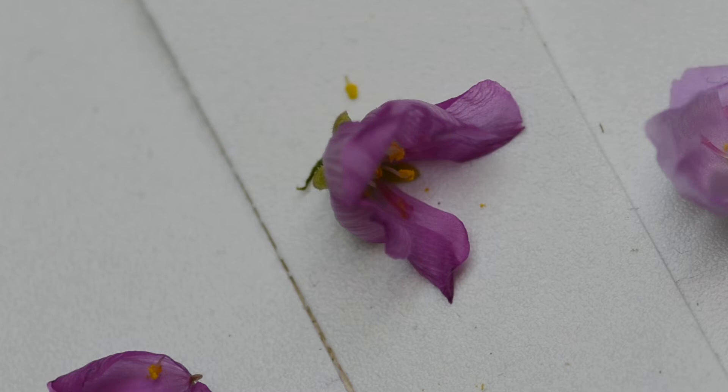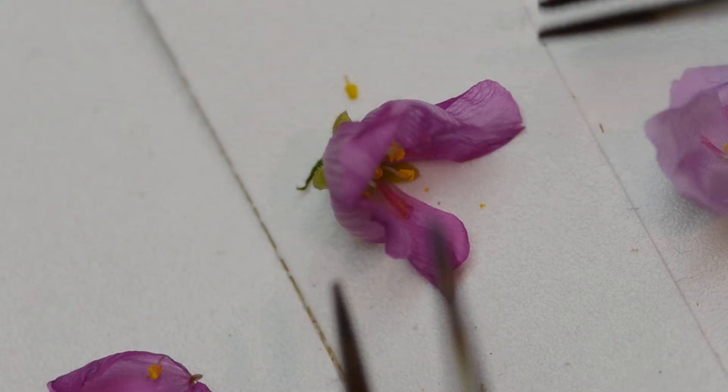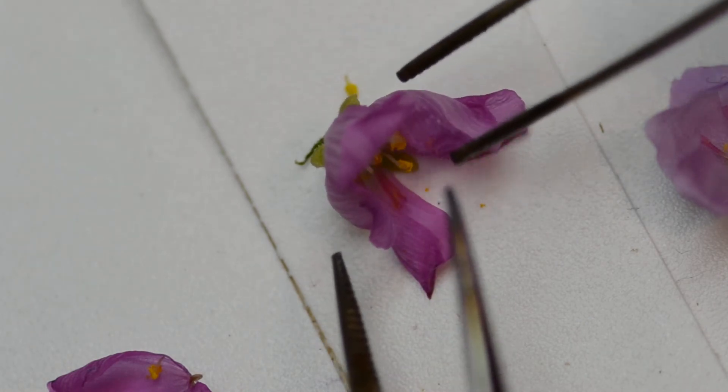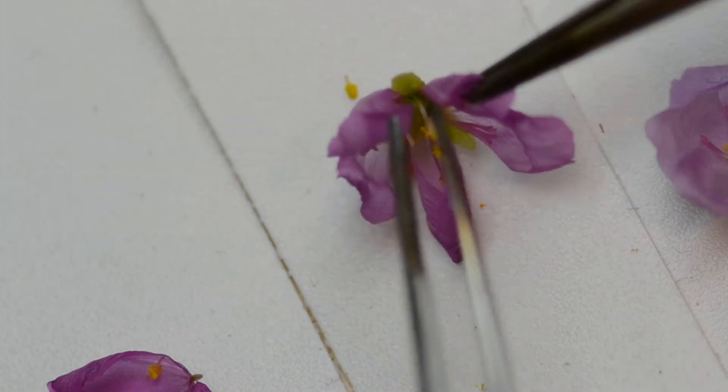Some parts of the flower I didn't mention in part one are hidden by the petals, so I'm going to go ahead and remove some of the petals so you guys can see.